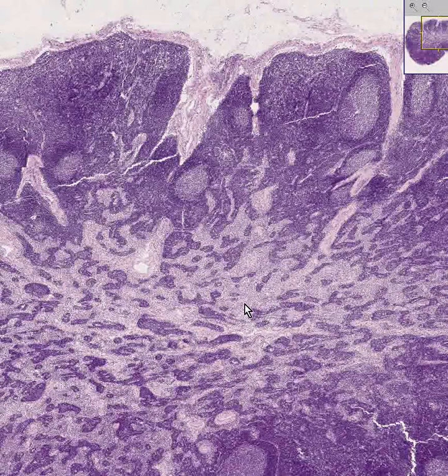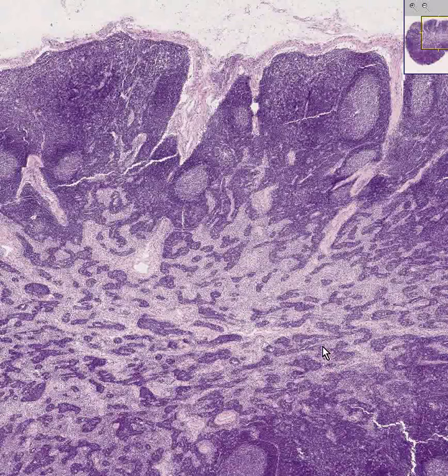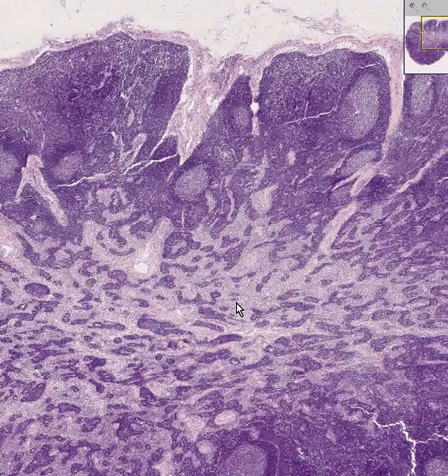Notice that in every classical normal lymph node, lymphoid follicles are only seen in the cortex of a lymph node, and in the medulla of a lymph node, you see medullary sinuses, which are these lighter areas, as well as the medullary cords, which are chiefly lymphocytes with smaller amounts of cytoplasm. This is what makes a normal lymph node.